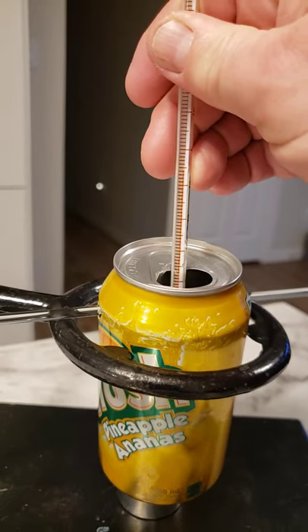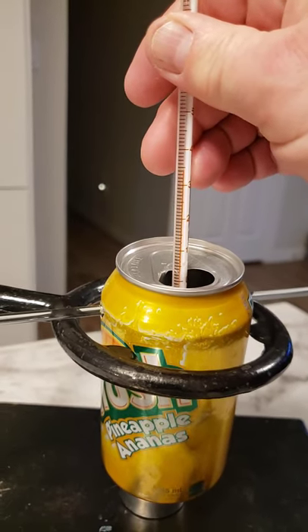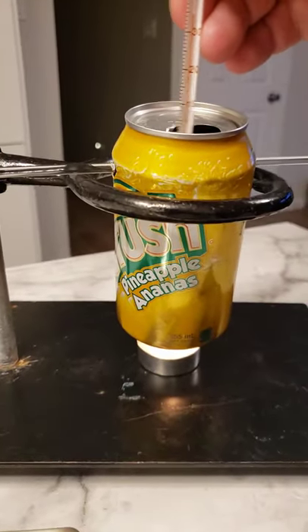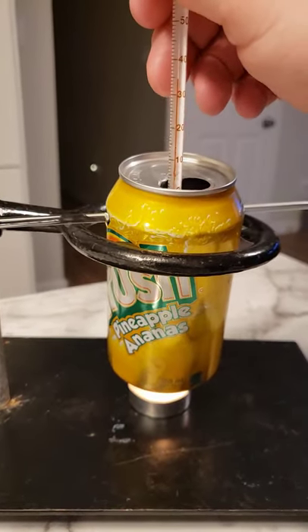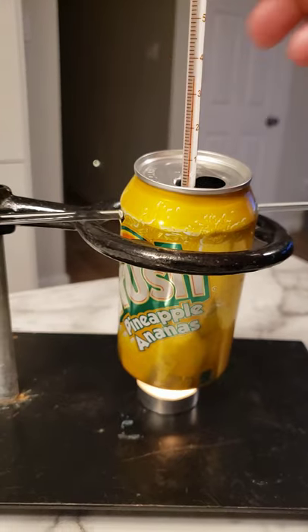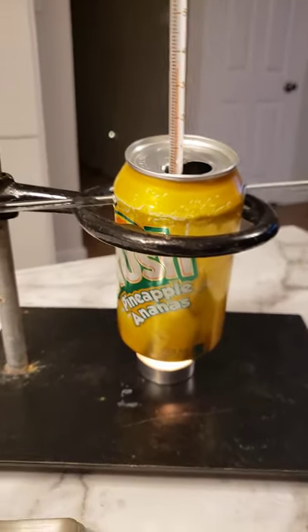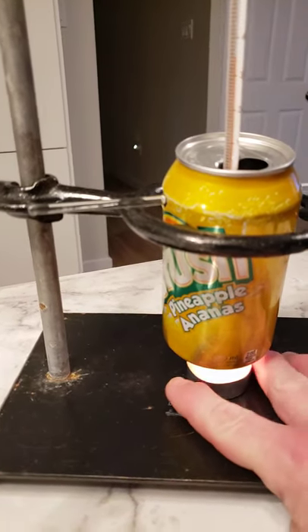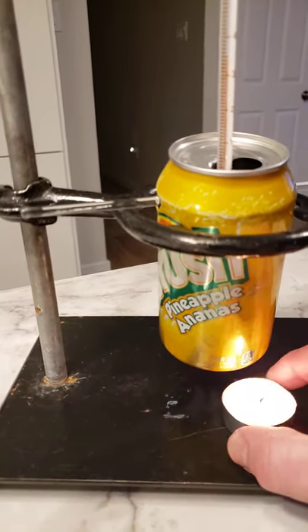We're back. As you can see, the temperature is 34 and with the candle flame still lit, it's still climbing. I'm going to turn on the balance — which I just did off screen — and I'm going to take out the candle and gently blow it out.